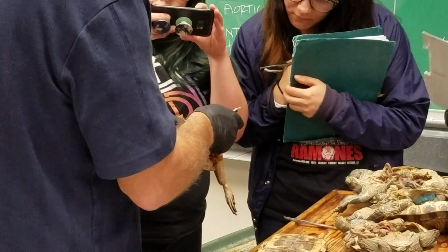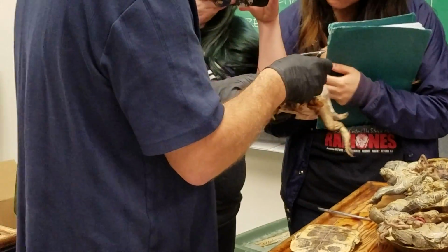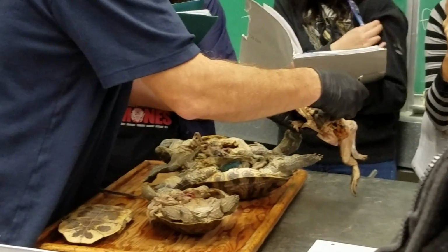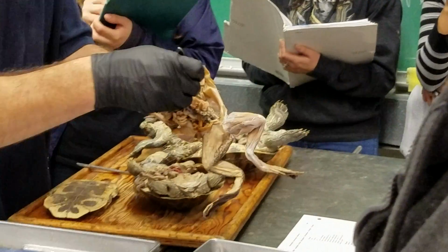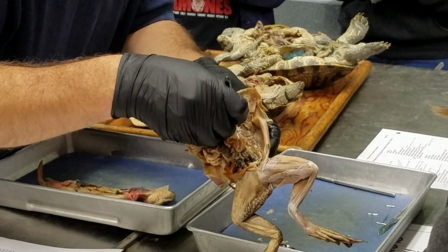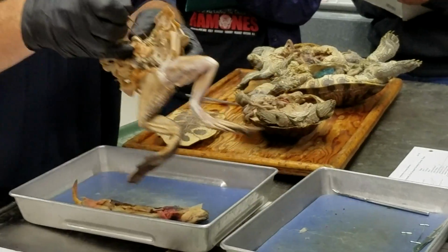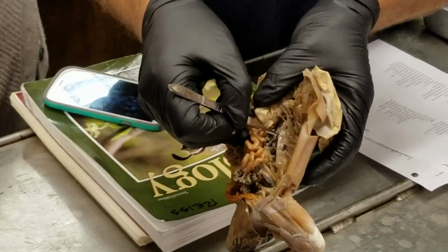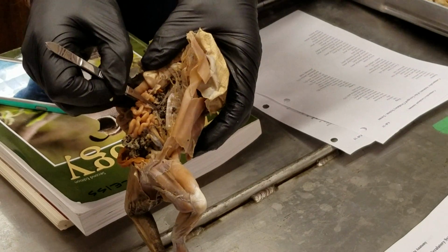And this is just like we just saw in the salamander, where the radices of the aorta come together to form that dorsal aorta. So here's the two systemic arches, left and right, coming together to form that single midline aorta. Here and here, two systemic arches coming together. There we go. Here and here, see those guys? Systemic arches coming together to form a single midline dorsal aorta.